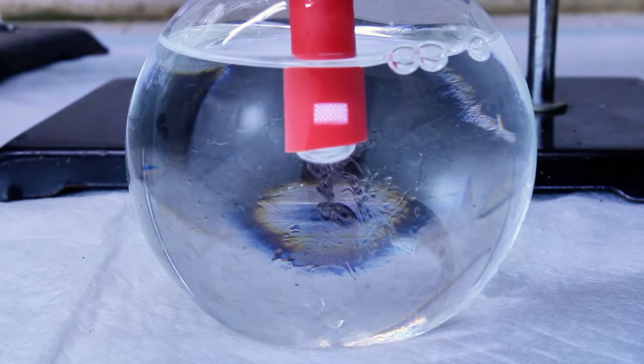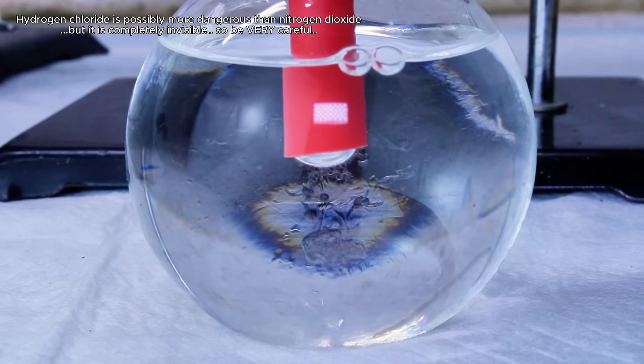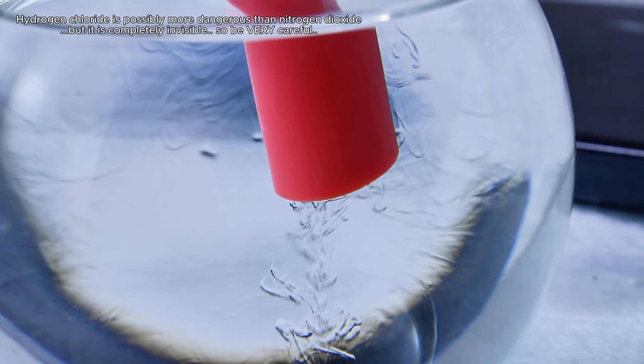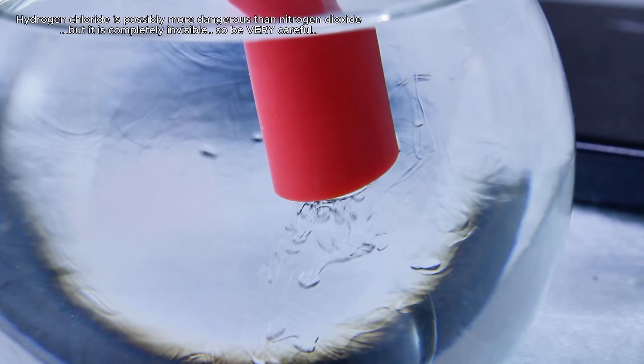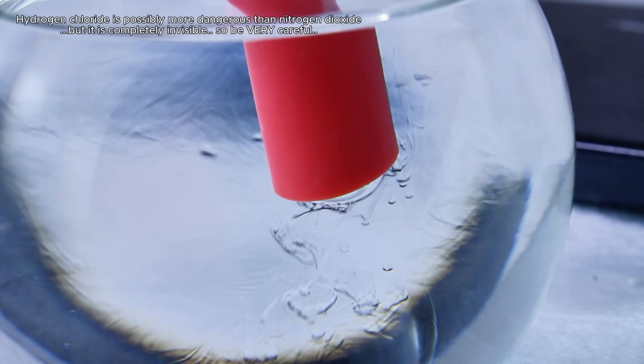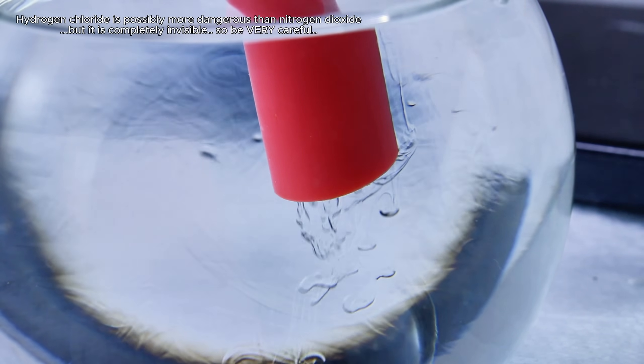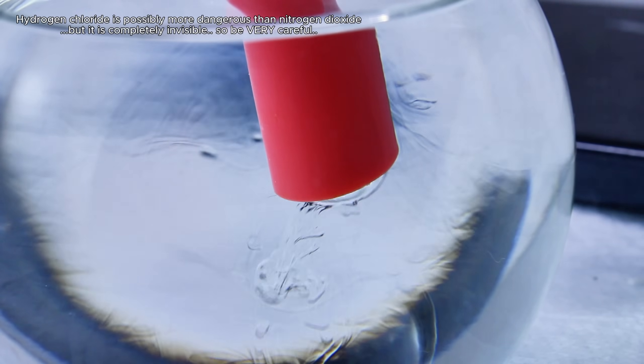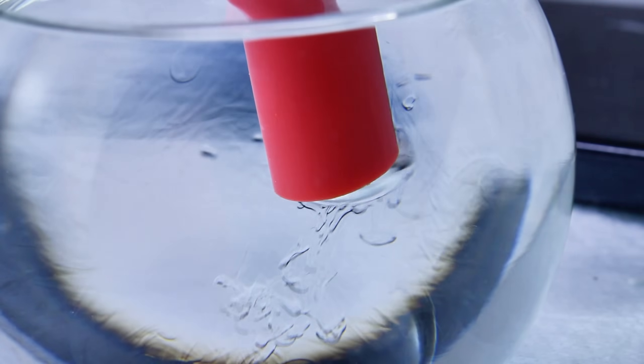The positive side is that it's a lot easier to control the formation of the extremely dangerous hydrogen chloride gas, unlike the extremely favorable reaction between sodium chloride and sulfuric acid, which generates plumes of the lethal gas on room temperature contacts. The downside is the formation of sodium sulfate, which will harden, prevent stirring, and prevent a yield anywhere near 100%.